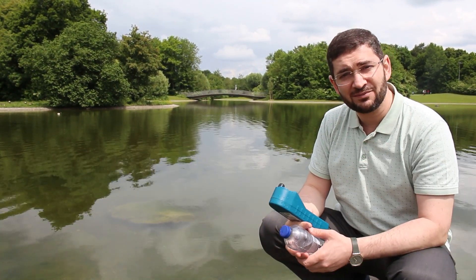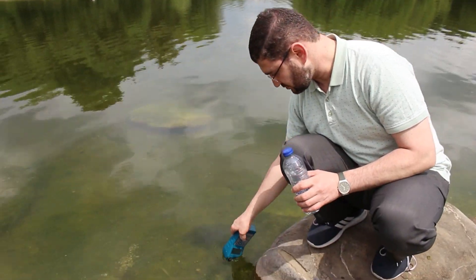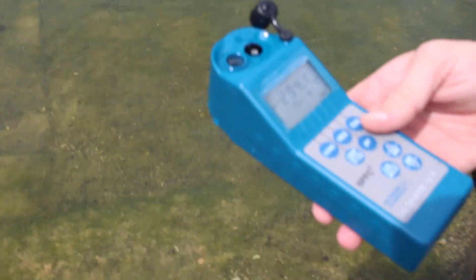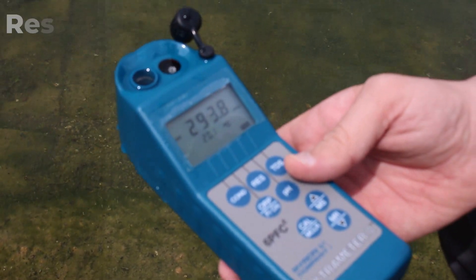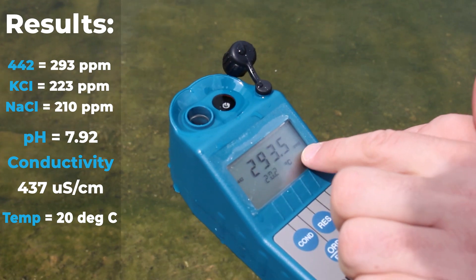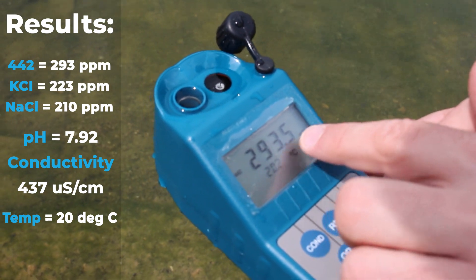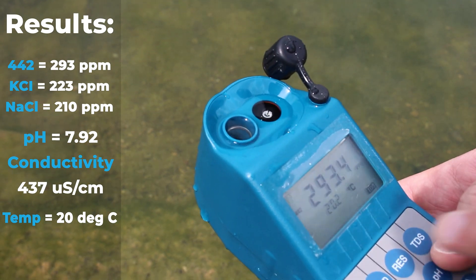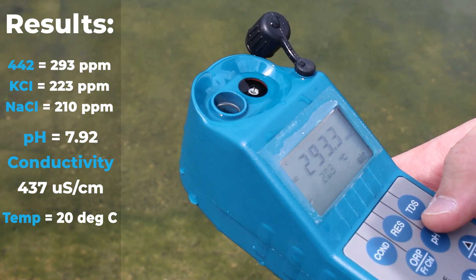We can see here that TDS at 20 degrees Celsius, measured as 442, is 293 to 294 ppm — ppm stands for milligrams per liter. That means we have 293.5 milligrams of different salts per liter of water at 20.2 degrees Celsius.